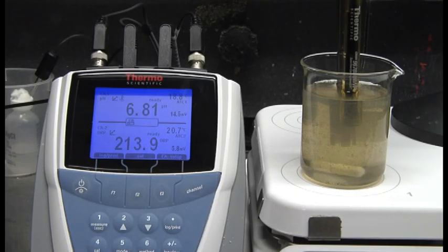Now we're going to perform our chlorine dioxide demand study. In order to do this, I've generated a stock solution of chlorine dioxide using the same chemical composition as the DuPont chlorine dioxide generator. I've analyzed the stock solution for its exact concentration and then used that concentration to calculate small incremental doses that we'll be using to run our demand study.